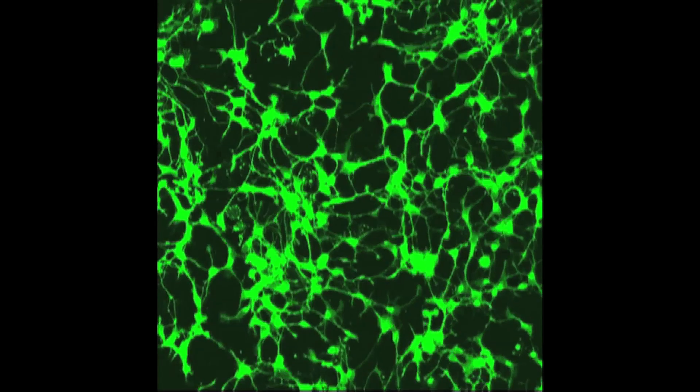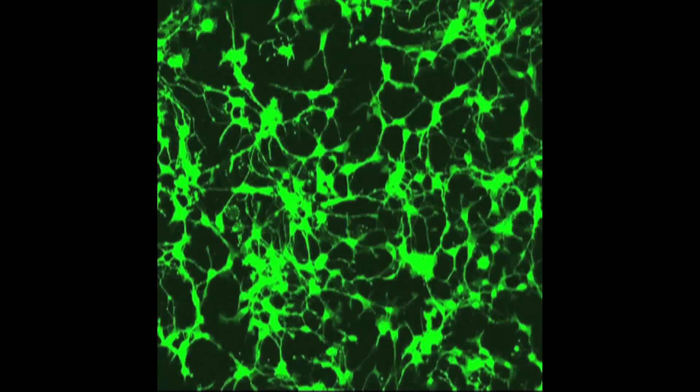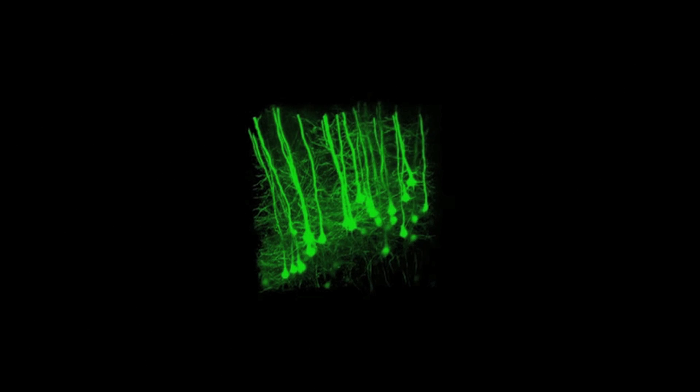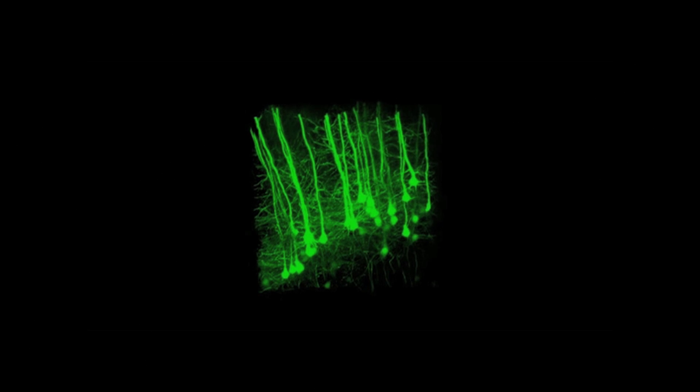There are a lot of events that have to do with plasticity, with our ability to learn, with our ability to modify our connections in response to the environment, that happen in the relatively superficial layers of the cortex that at this point are accessible by multiphoton today.